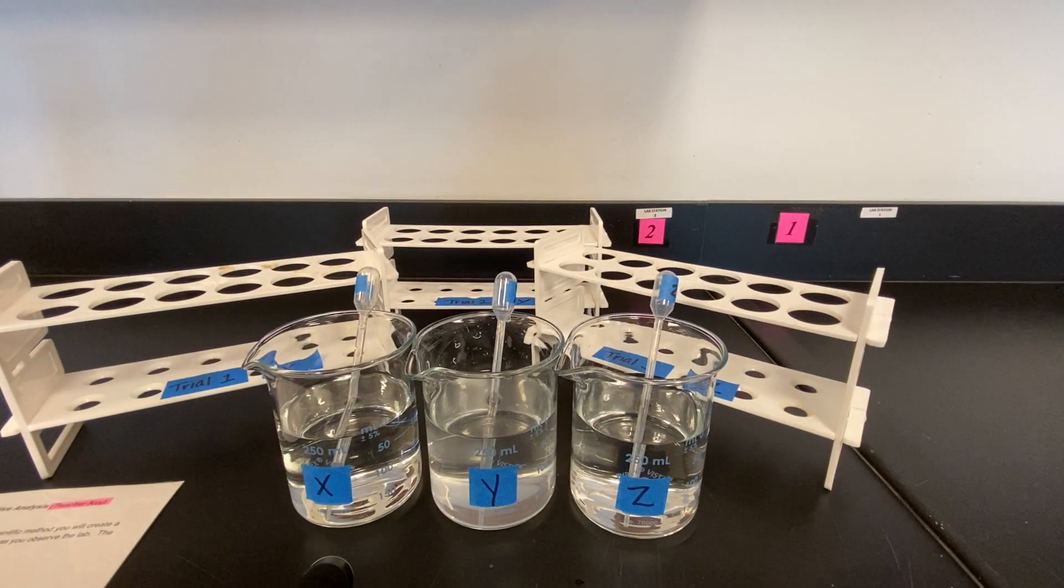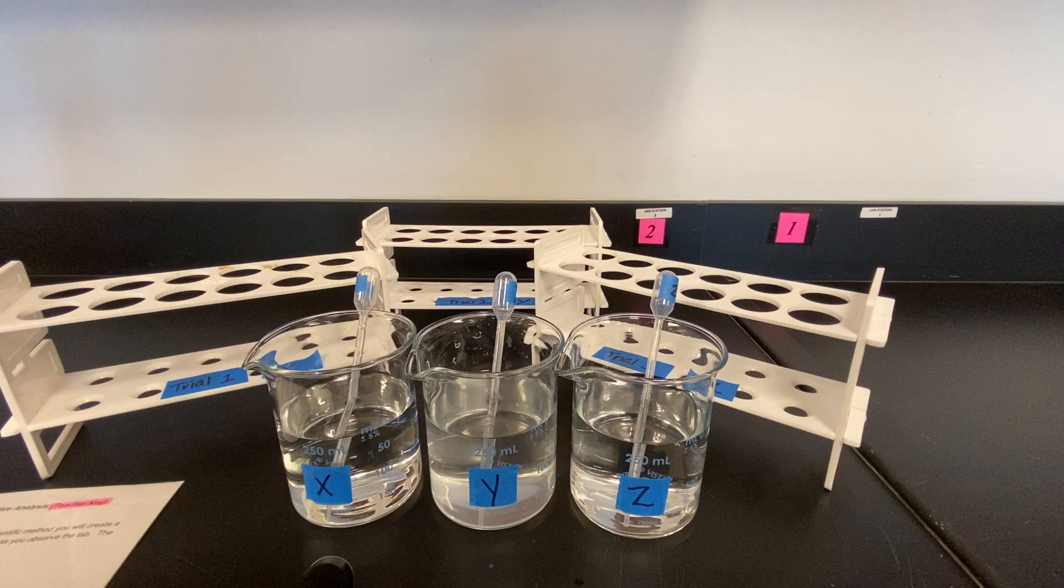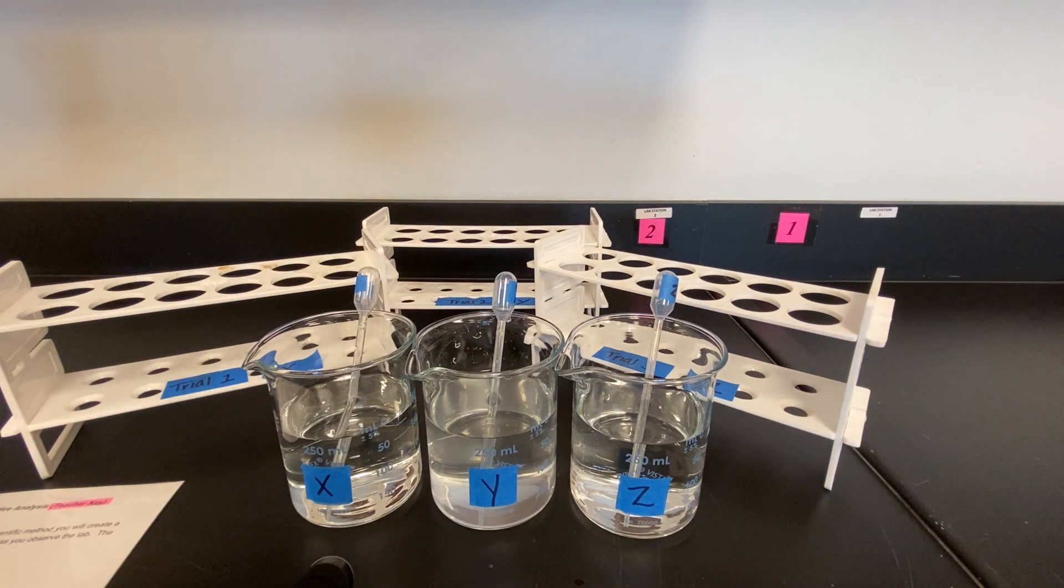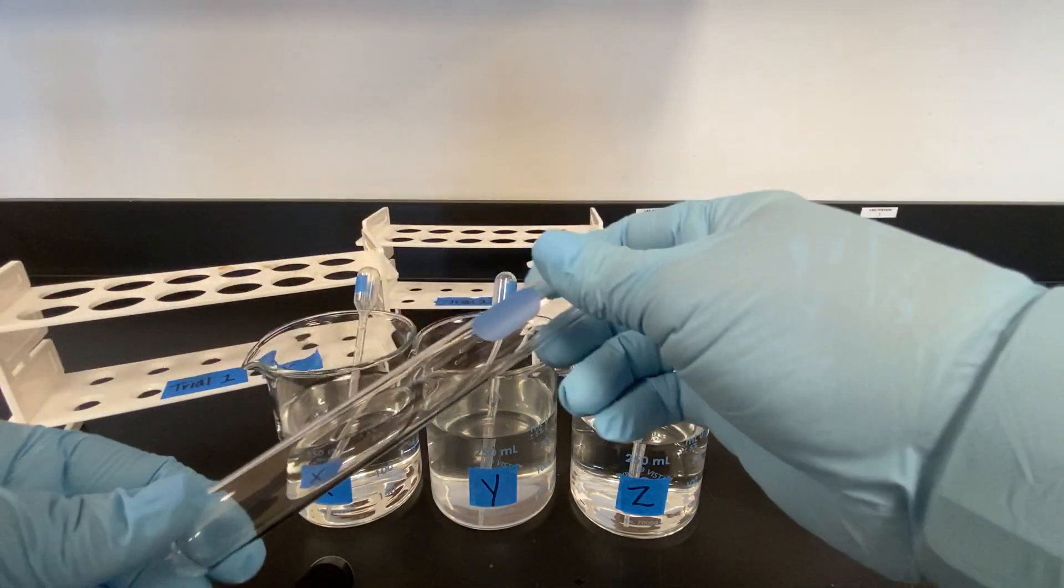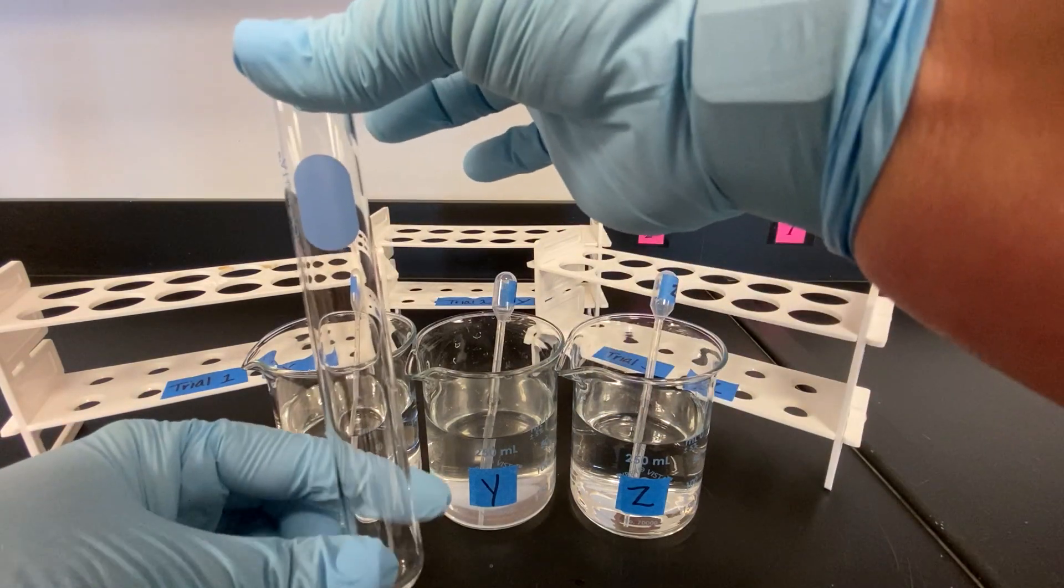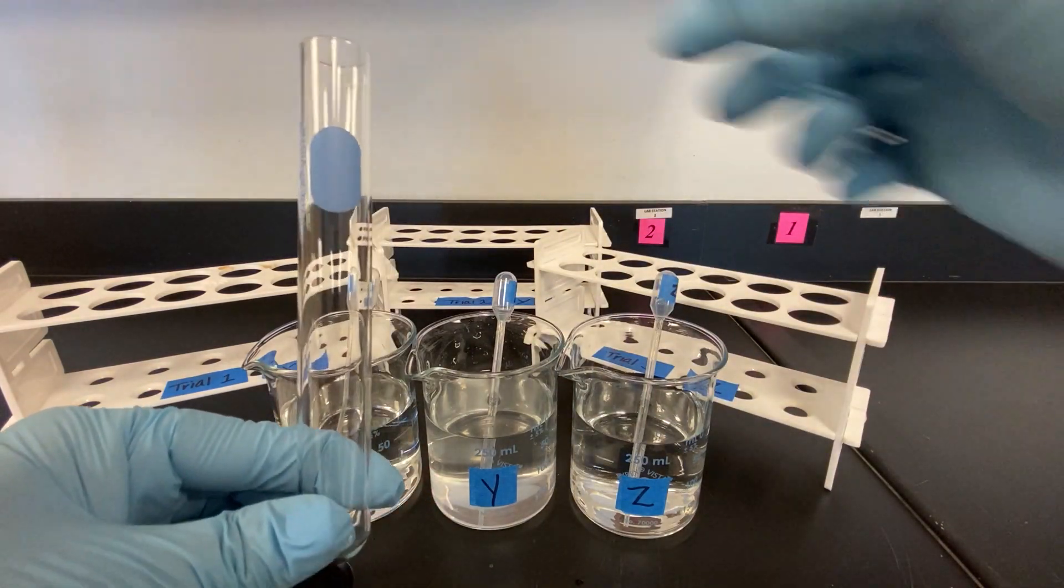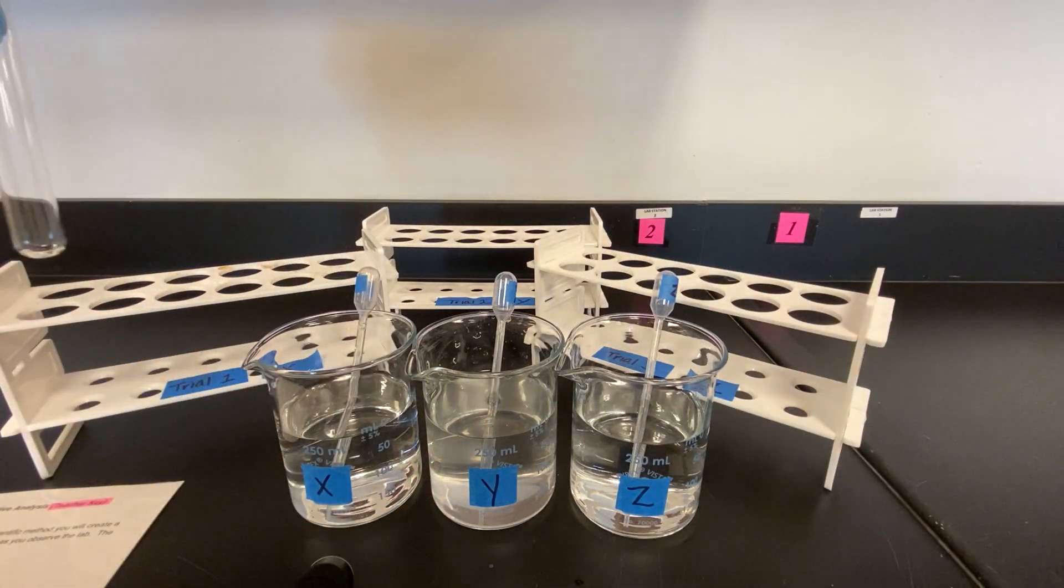For this particular experiment we will have nine test tubes. Each test tube is unlabeled and each test tube holds the same quantity of liquid solution.